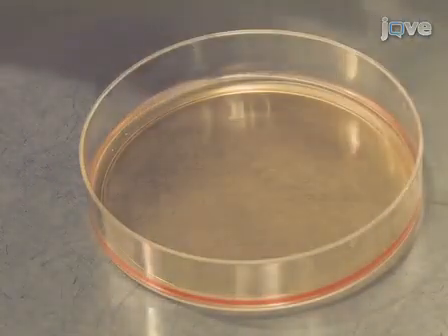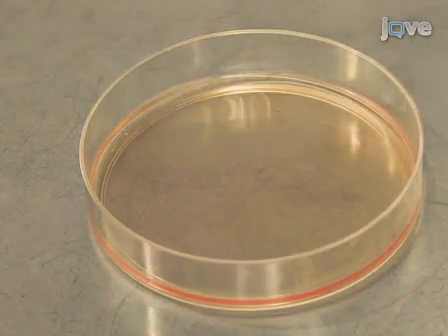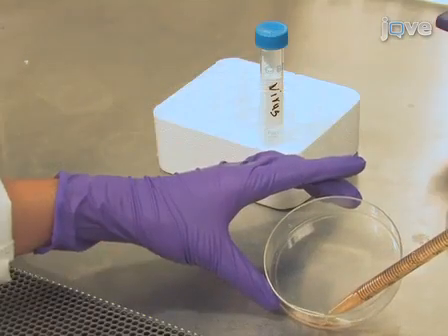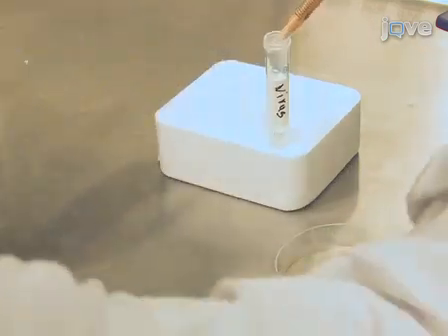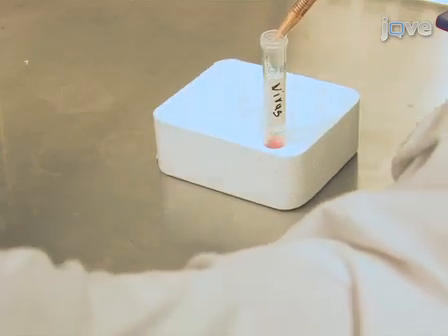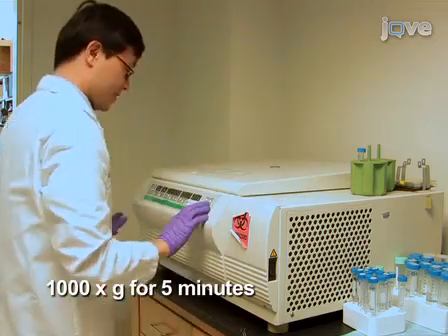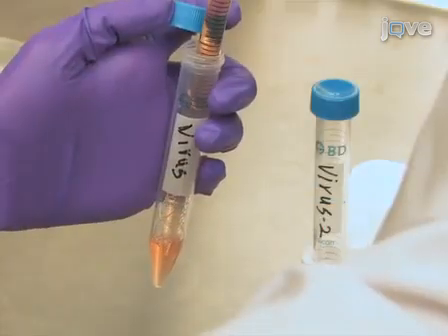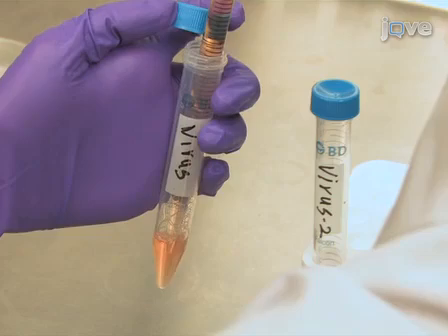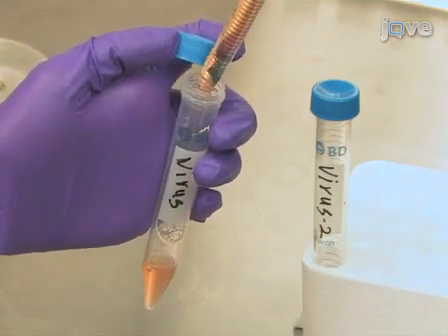After 2 days of virus production, the medium in the platinum E cell plate should become yellow. Transfer the viral supernatant to a 15 milliliter conical tube. To remove cell debris, centrifuge the virus supernatant at 1000 times G for 5 minutes. Carefully transfer the virus supernatant to a new tube. Leave some liquid at the bottom of the tube and do not disturb the cell debris.